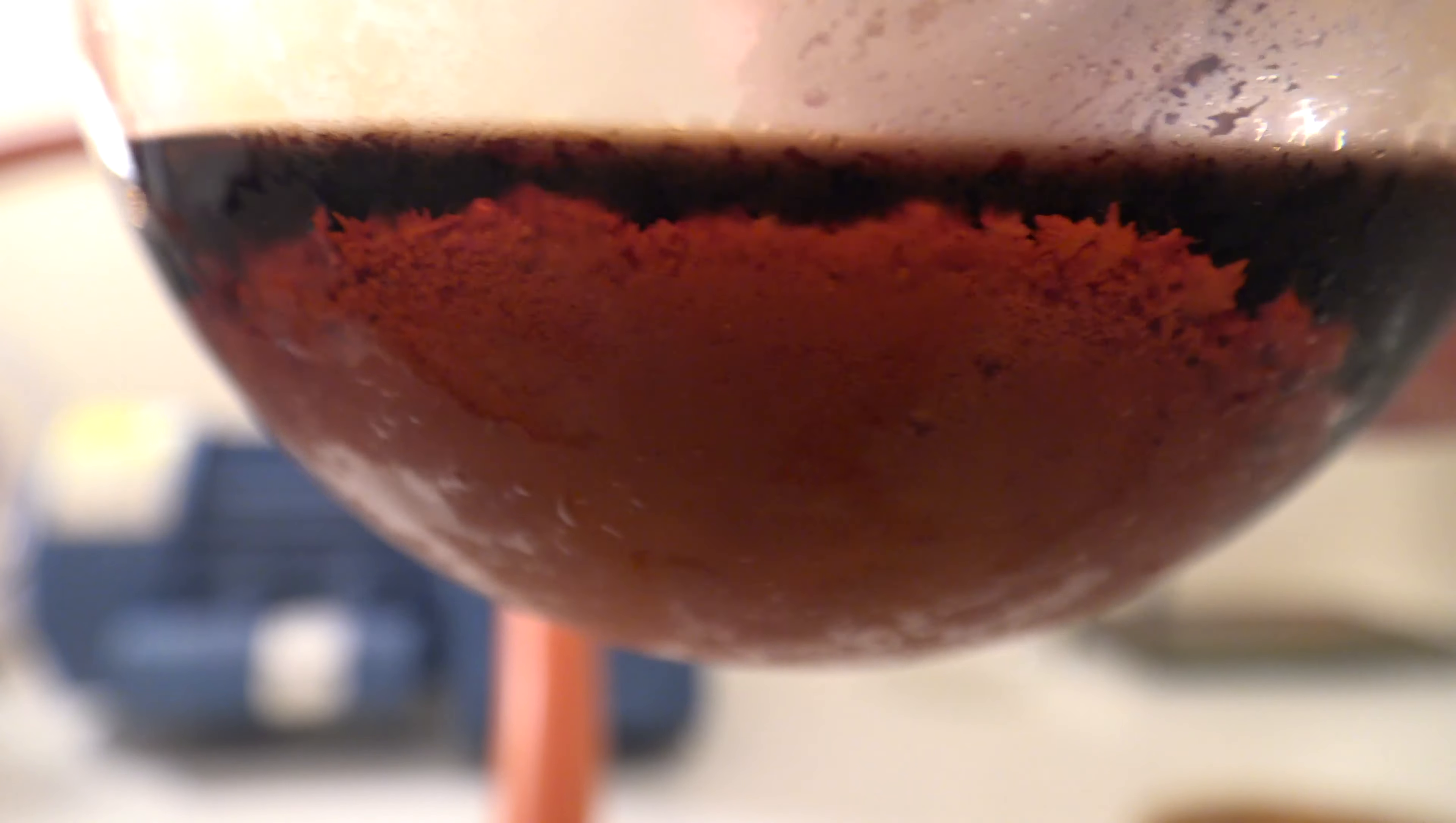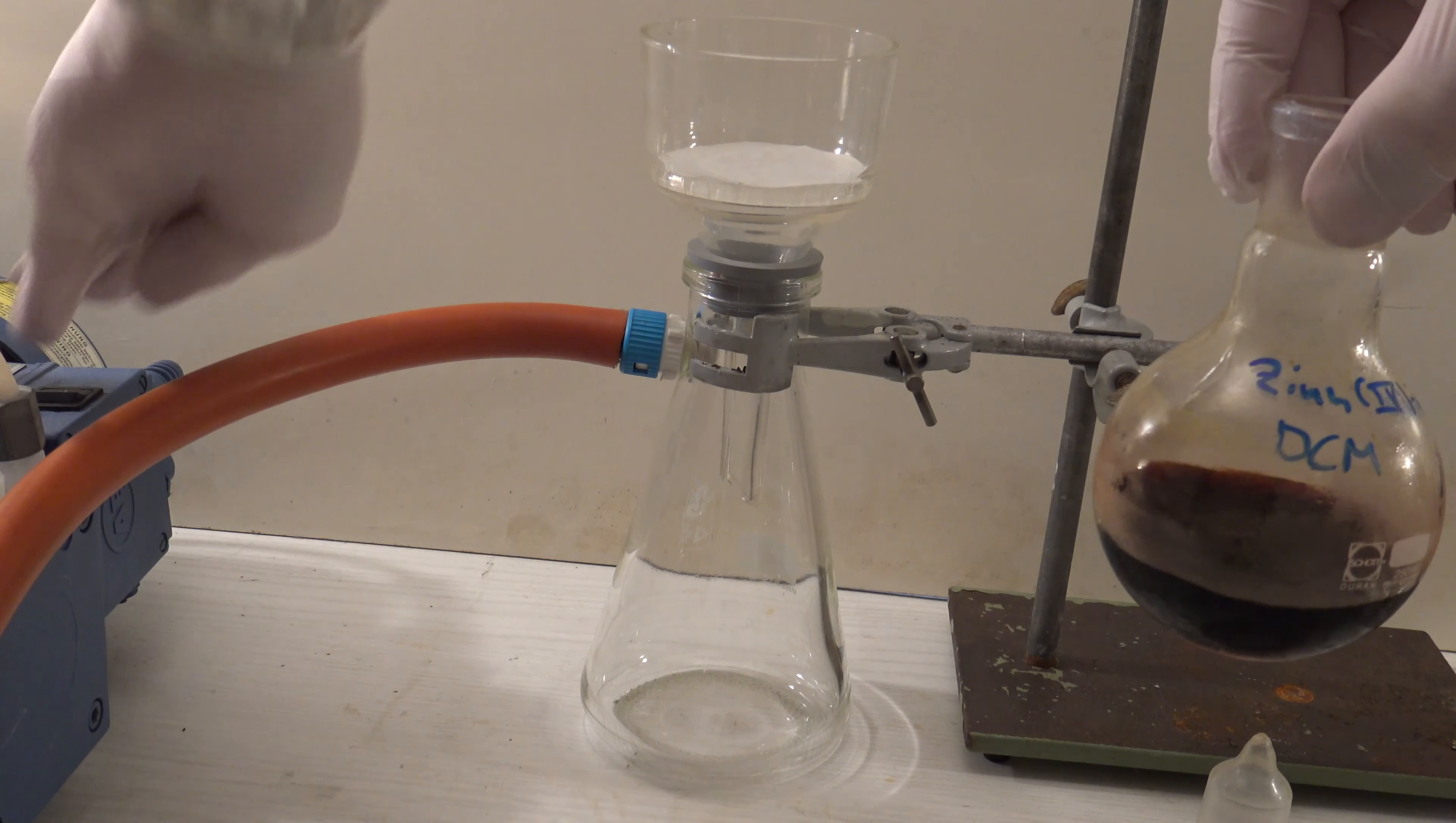The next day a larger amount of crystals had formed which were then filtered off. The product was removed with a vacuum filtration.